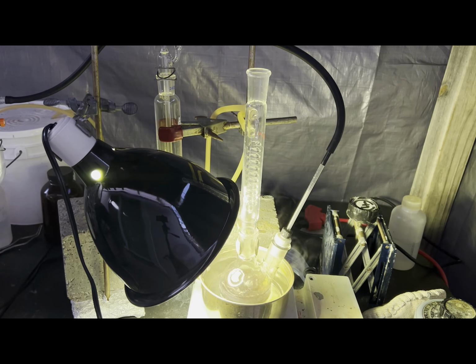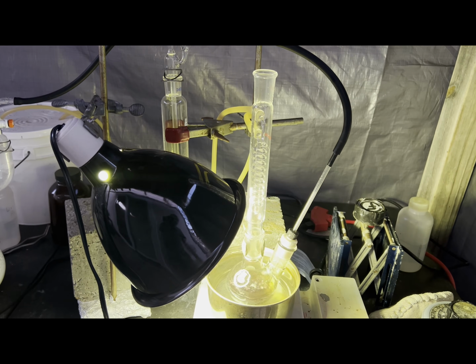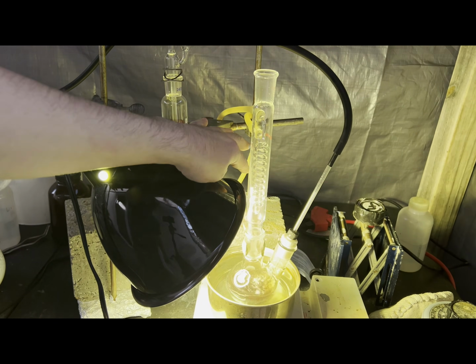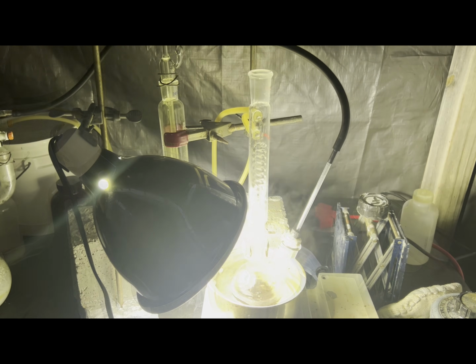The reason for this is the lamp heated up like half of the condenser since it also radiates heat, so some acetic acid escaped instead of refluxing and staying contained. Chloroacetic acid boils at a much higher temperature than acetic acid, so I'm going to assume none of it escaped the reaction vessel.